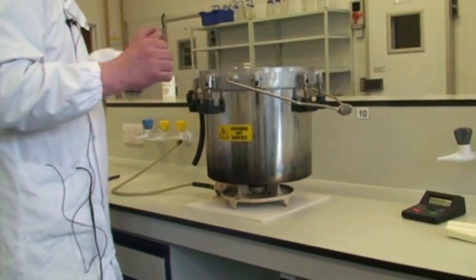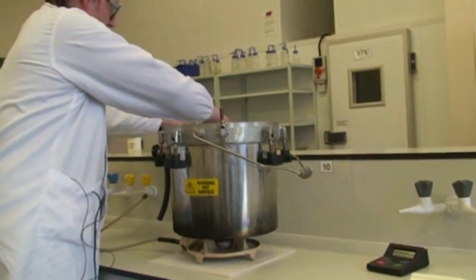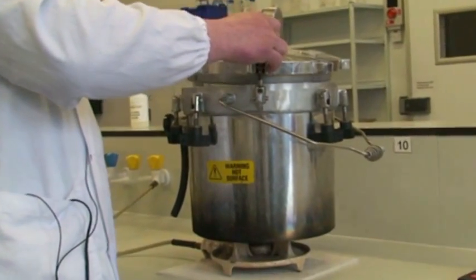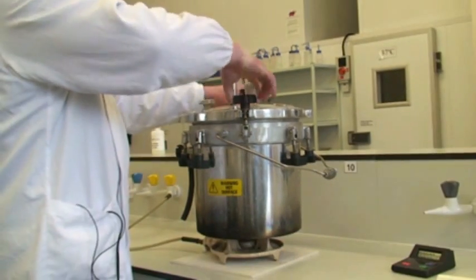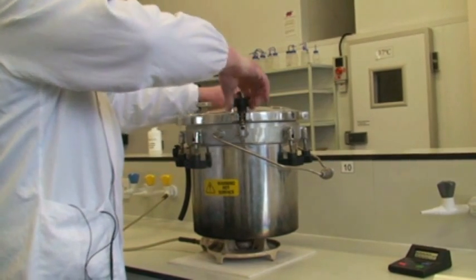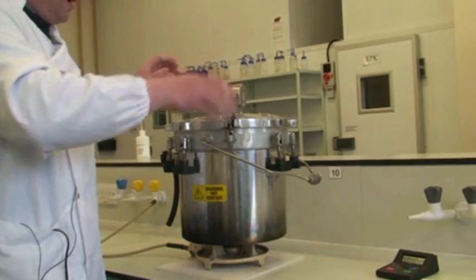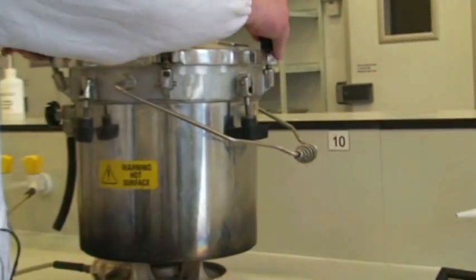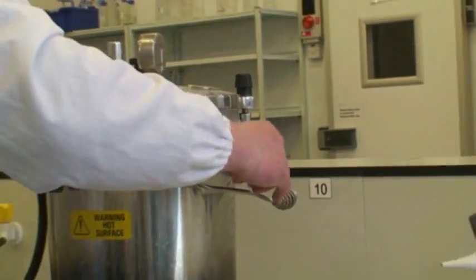Now you're ready to put the lid on. The two fixed wingnuts on the lid go on the two without wingnuts on the base autoclave. Just firmly clip each one down, making sure they're tight. Then go round the others opposite, using the two opposite each other rather than going round like so.